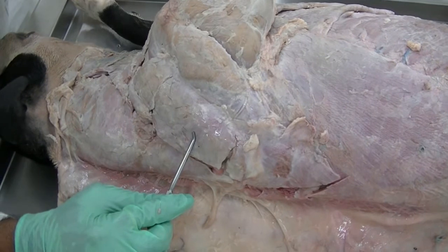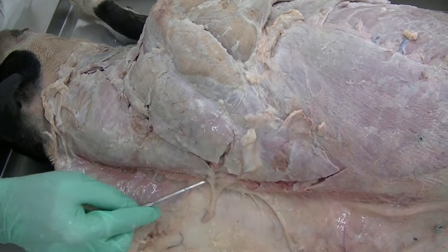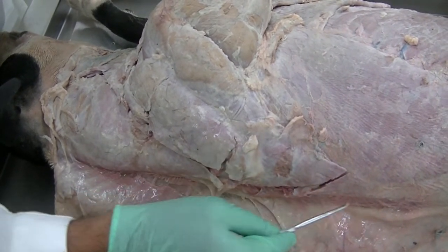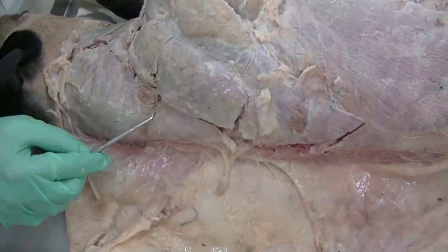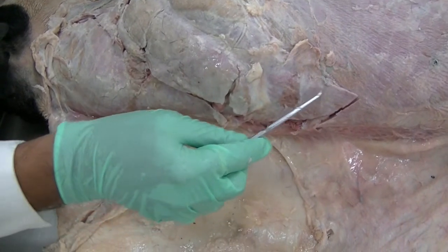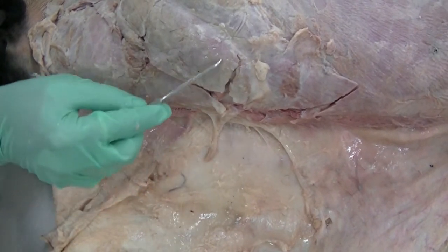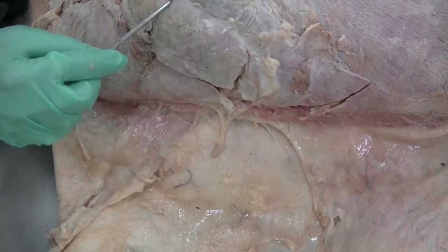Now the trapezius is another extrinsic muscle which is coming from the dorsal midline, having two different parts: part of the muscle which is associated more with the trunk of the animal, and the part which is associated with the neck of the animal. This part is the thoracic part of the trapezius muscle, which also attaches to the spine, while we have the cervical portion of the trapezius muscle which also attaches to the spine.